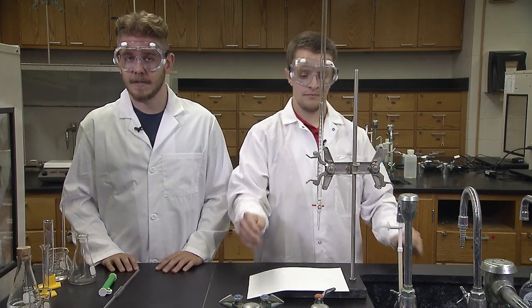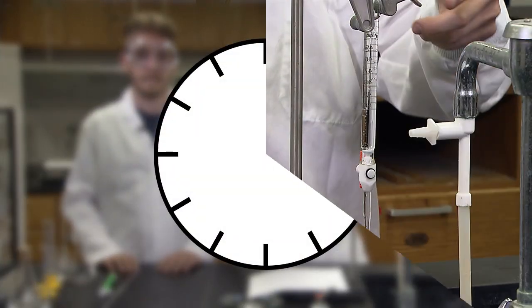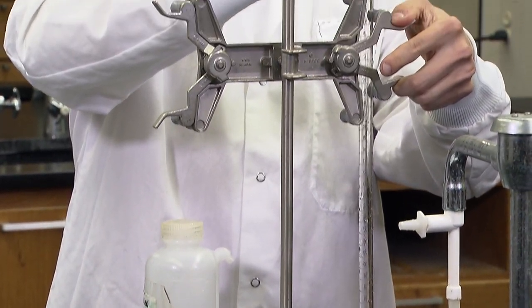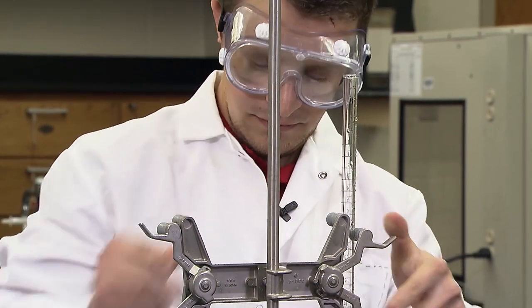Refill the burette with sodium hydroxide between trials. After completing all three trials, rinse the pipette and the burette in the sink and then return them to the cart.